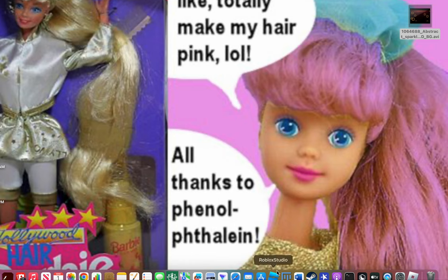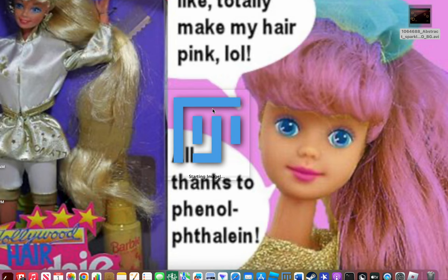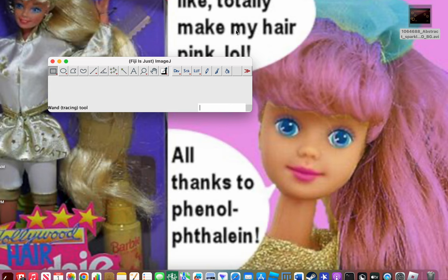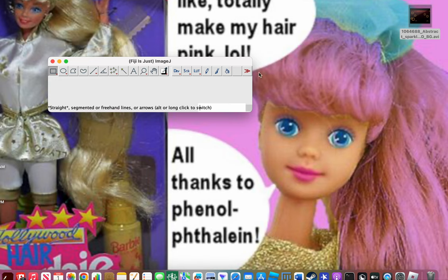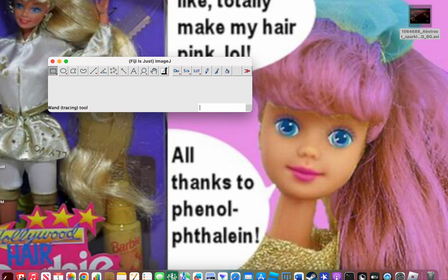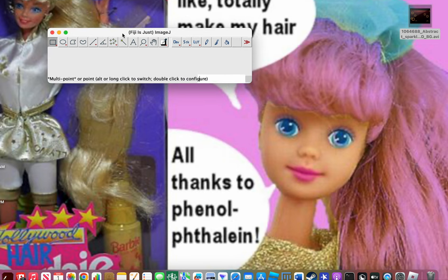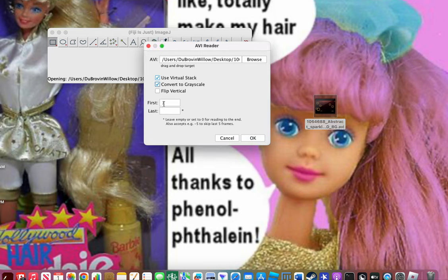Now open up the Fiji software — this is ImageJ, they're essentially the same thing. Once you download and open it, on a Mac you should see a menu bar at the top with options like Image, Process, Analyze, and Plugins. You're going to take your file and drop it in. The first thing you need to do is convert to grayscale — TrackMate does not read in RGB, so you have to make sure you're in grayscale.